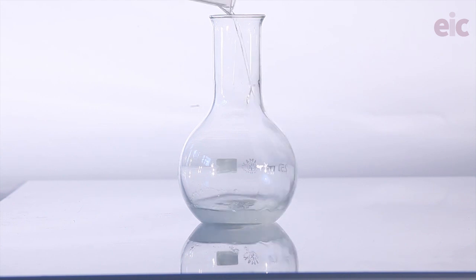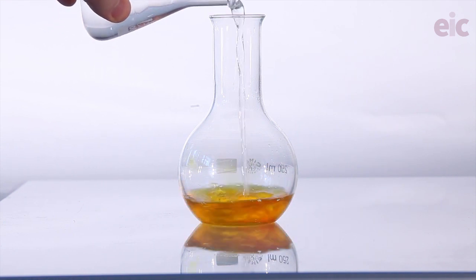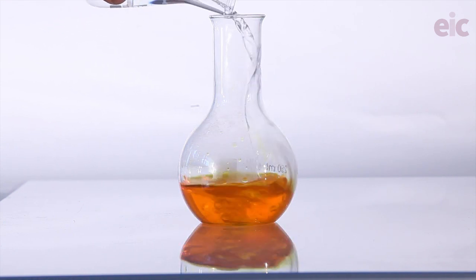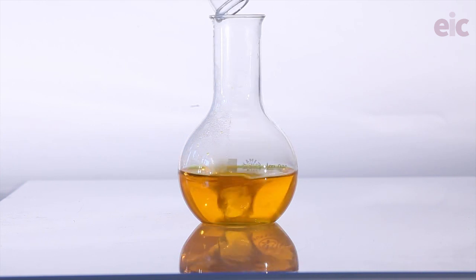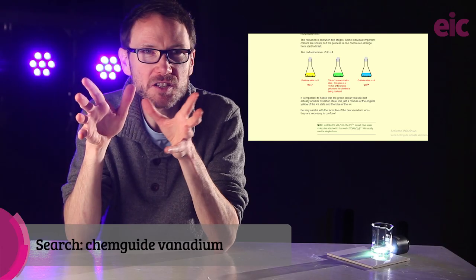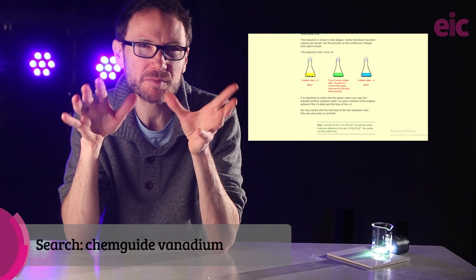The nice thing about this method is how easy it is to dissolve the metavanadate 5. You're making it up first in a 2 mole per decimeter cubed solution of sodium hydroxide and then acidifying afterwards with sulfuric acid. You'll get these lovely color effects along the way. Note the pH dependence as well of the colors. There's more going on here than just dilution, and that's going to become crucial for us later on. Jim Clark's Chem Guide is a great place to drop in for some discussion on the exact species that we're seeing in solution.